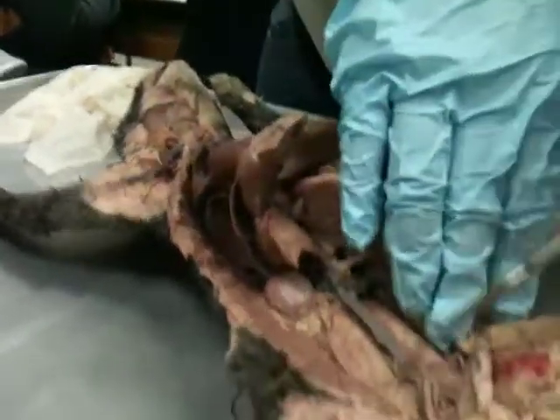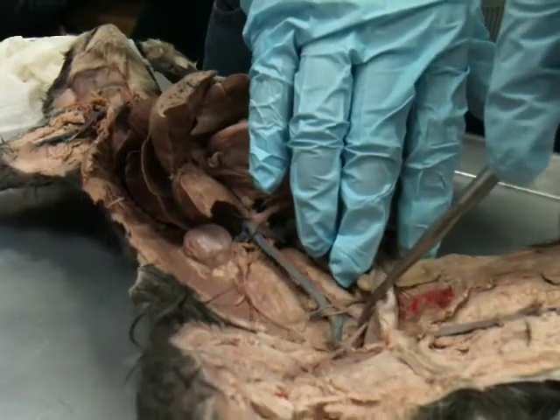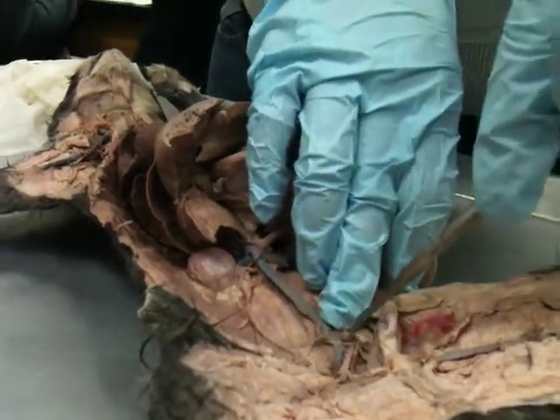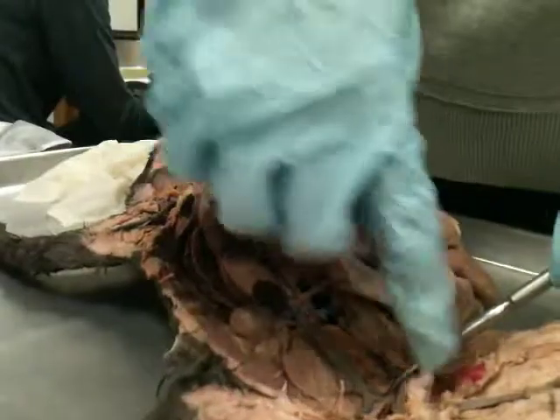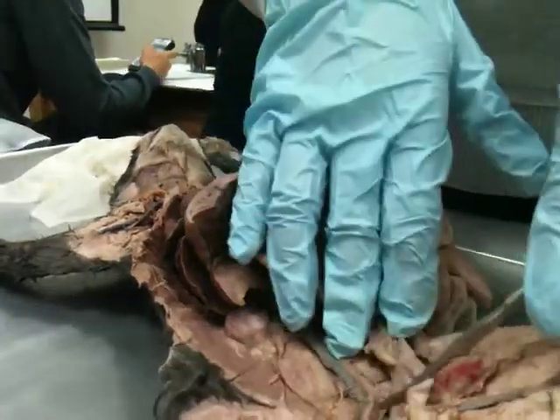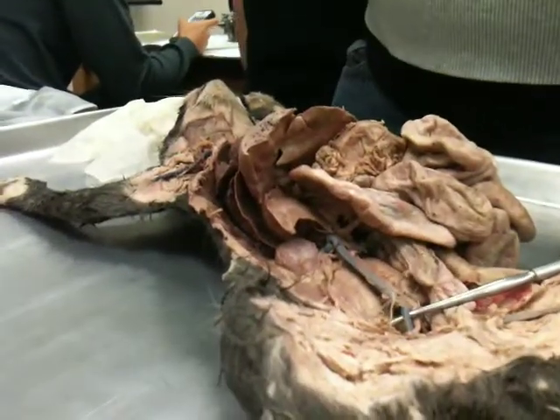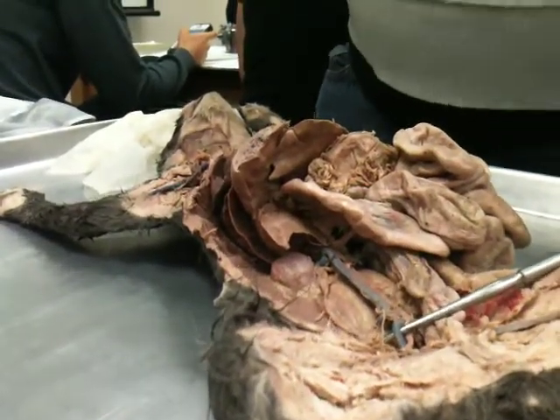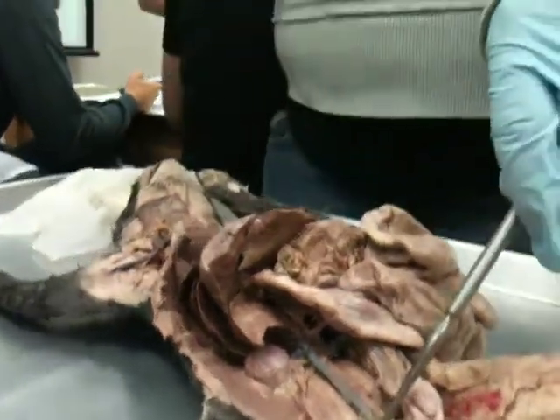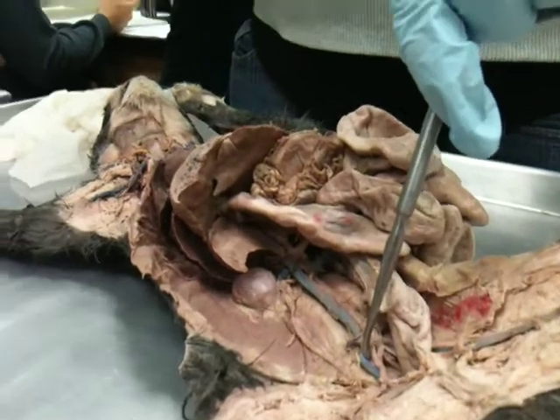Okay. And then we can follow the vena cava all the way down, right? The inferior vena cava to where it branches, okay, or ends. So we have a right branch and a left branch, and we're right over the hip bone. So what do you think this is? Iliac. So if you put that on the practical, we're not going to make you differentiate between external or internal. They're so close to each other, we just put iliac vein. Yeah, that's going to be fine. Okay. And the same thing will go for the arteries.